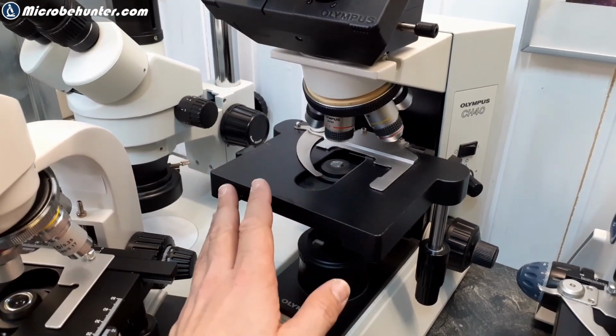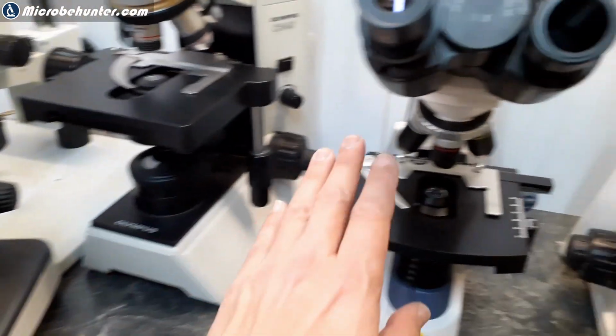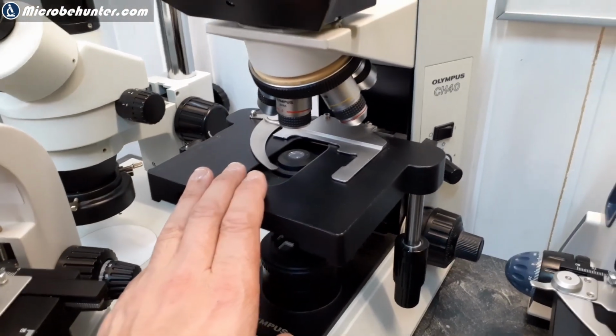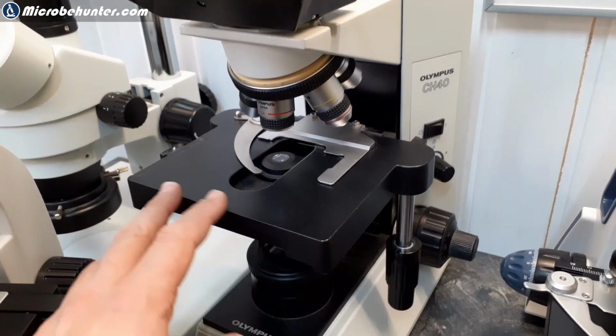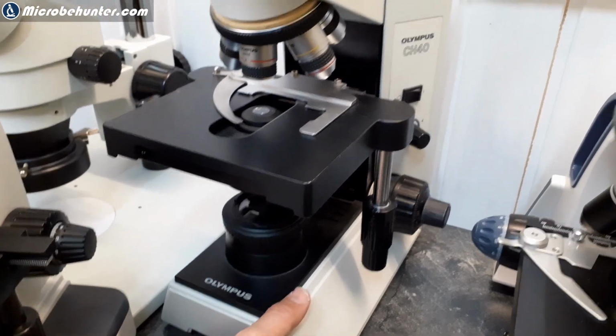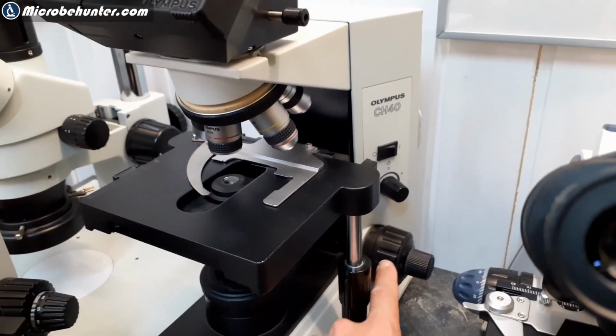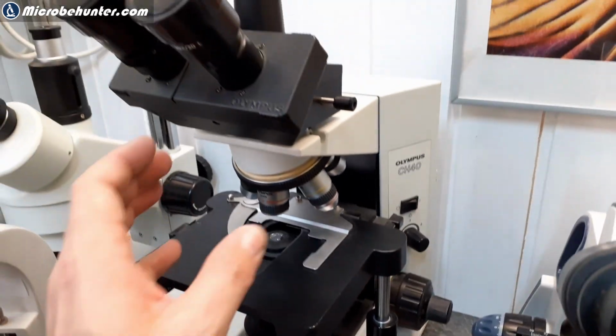And ultimately, it's got the same features as the significantly lower cost microscopes of these days. I paid several thousand euros for that back in 98, and converted now, of course. At that time, so several thousand US dollars for that. Okay, same concept, of course. Fine focus knob, mechanical stage, power, all of these things.